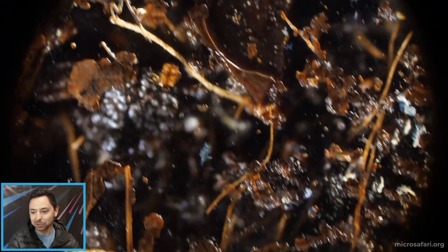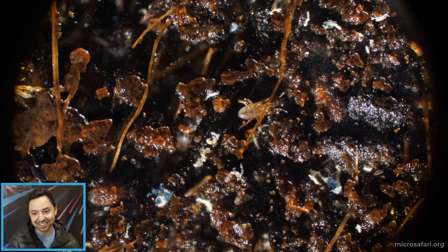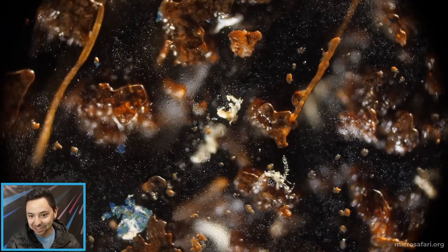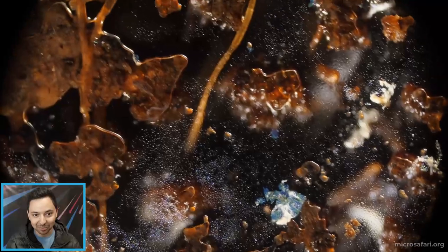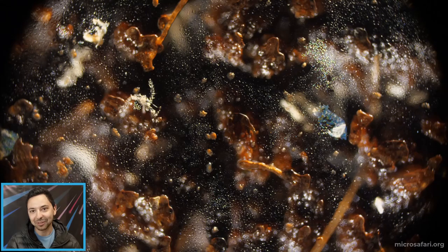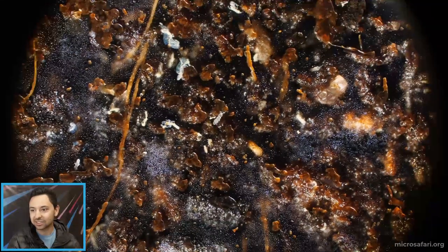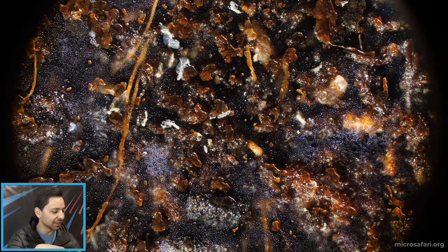I'm hoping we'll see some soil mites here — oh okay, yeah, here we go, here's a little soil mite! Let's zoom in before he runs away. These guys are so camera shy — they always try to run away and somehow always know that I'm trying to take a video of them. One of my favorite organisms and yet they're just so elusive. Maybe we'll find another one. You can see this water condensation forming all these little droplets because of the lights on the microscope.